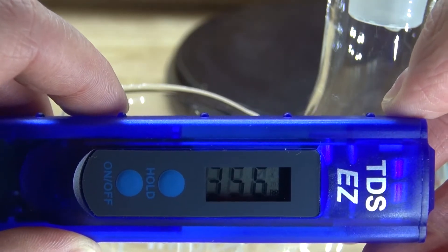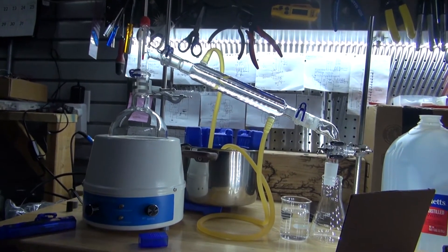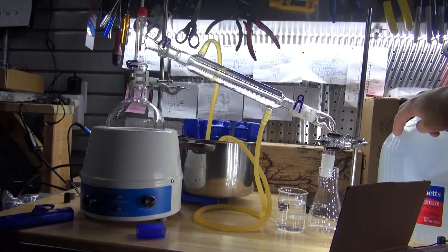Next I need to take my tap water and place it inside my distillation apparatus to create pure distilled water. I want to see if it matches the commercial brand.